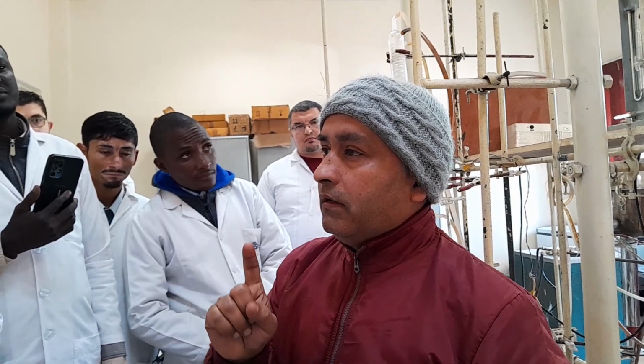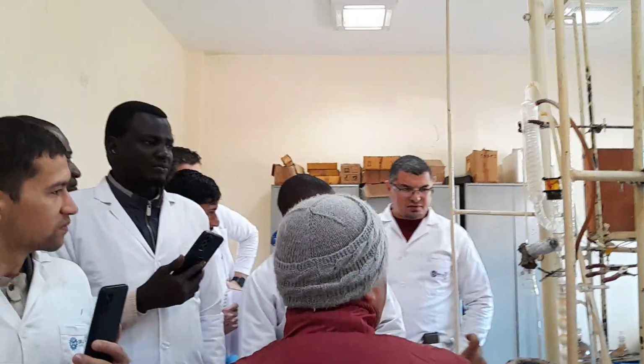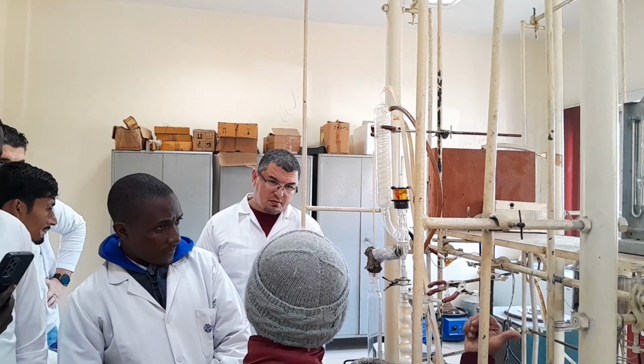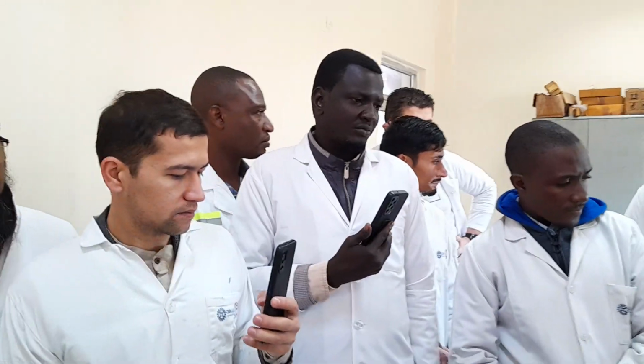Very, very important. Now, the second is FBP, final boiling point. The first question again: what is the difference between the IBP by D86 and the IBP by fractional distillation? The IBP by fractional distillation is lower than the IBP by D86. It is always lower.